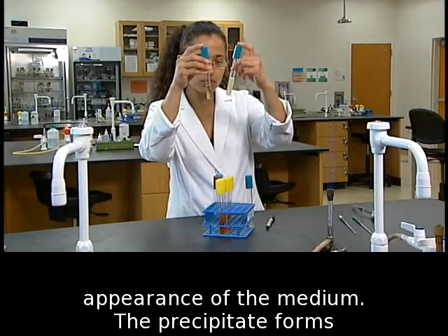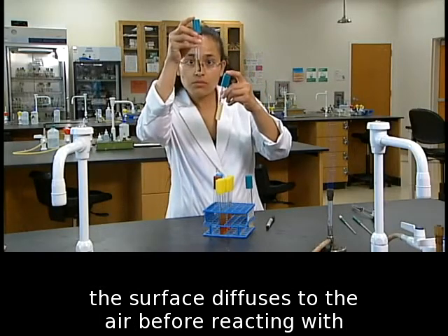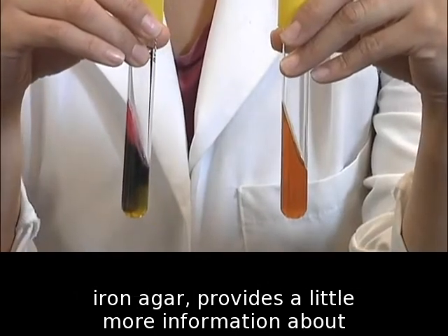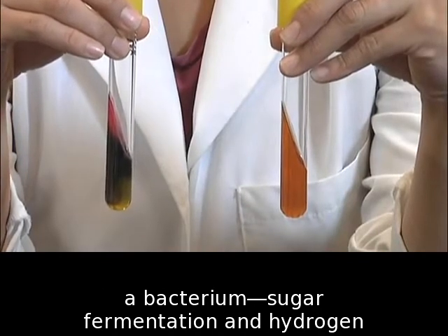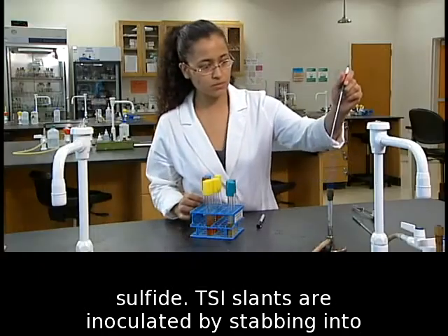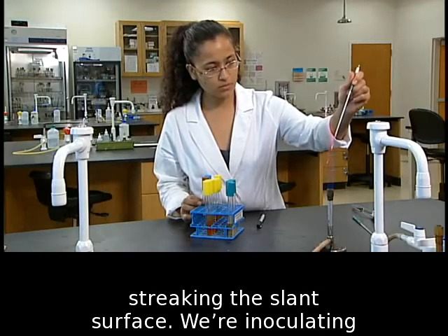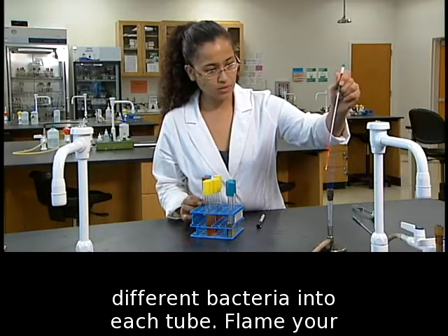The precipitate forms in the butt because hydrogen sulfide formed at the surface diffuses to the air before reacting with the ferrous ions. The other medium, triple sugar iron agar, provides a little more information about a bacterium, sugar fermentation, and hydrogen sulfide. TSI slants are inoculated by stabbing into the agar to the bottom of the tube and then streaking the slant surface. We're inoculating different bacteria into each tube.